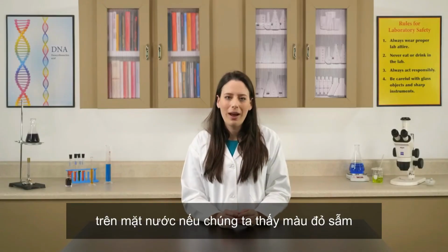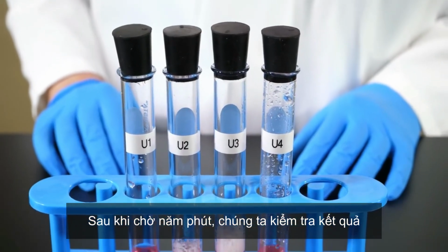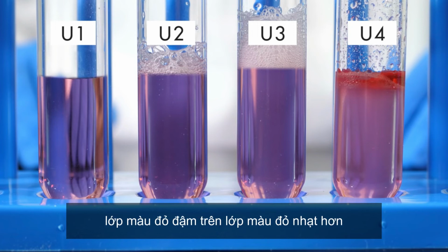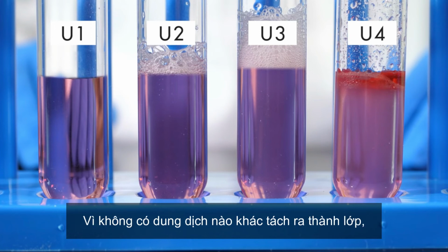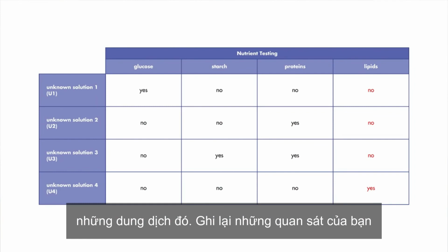If we see a dark red layer floating on top of the water, we know lipids are present in the solution. After waiting approximately 5 minutes, we examine the results. Notice that the sample containing unknown solution 4 has separated into a dark red layer above a lighter red layer. This means lipids are present in unknown solution 4. Since none of the other unknown solutions separated into layers, we know that lipids are not present in those solutions. Record your observations in your lab journal.